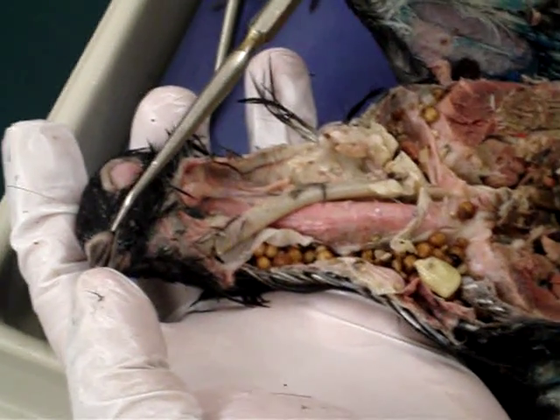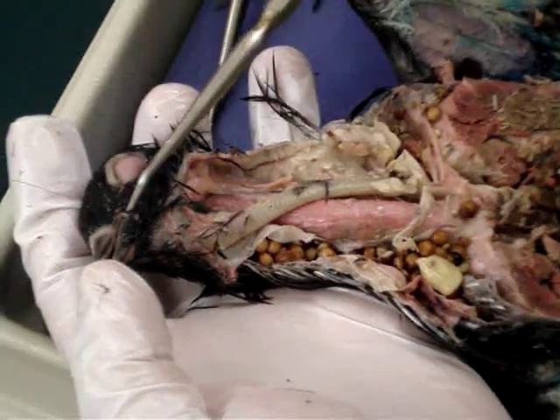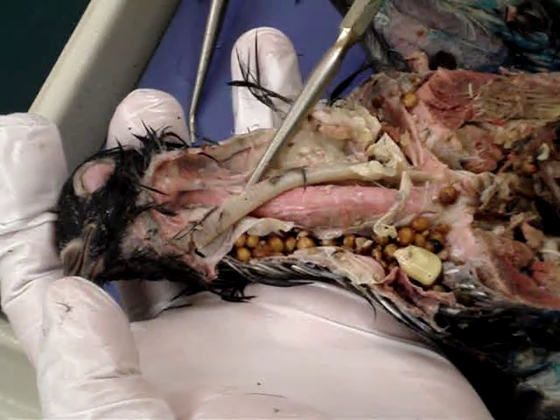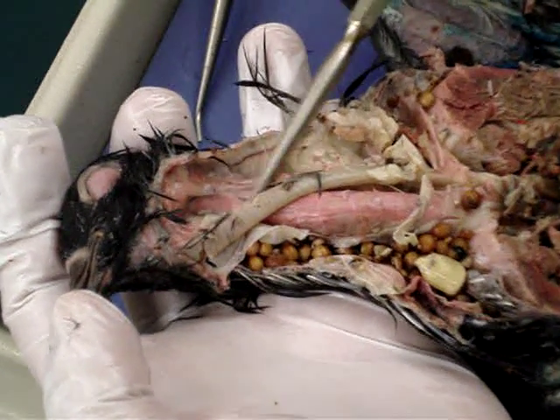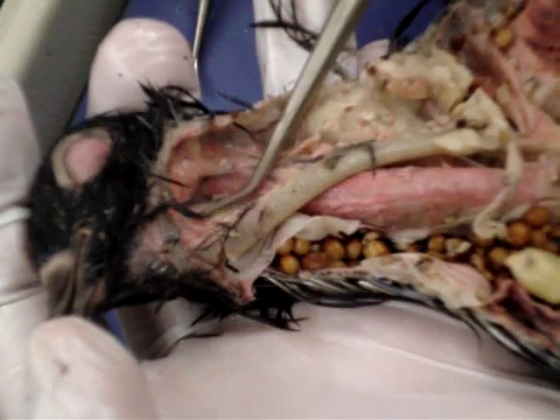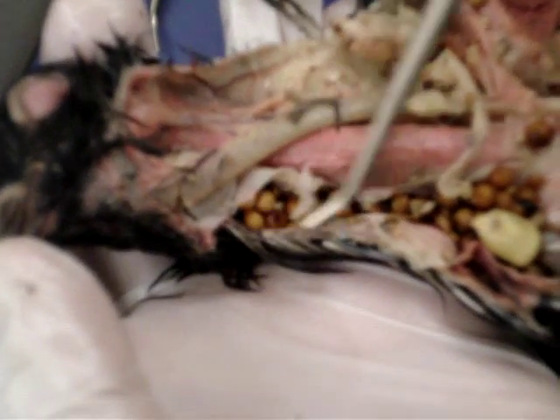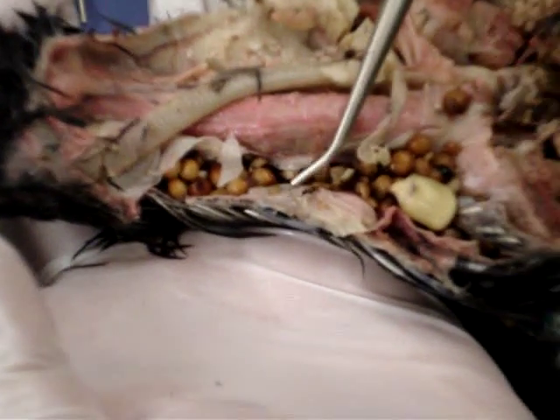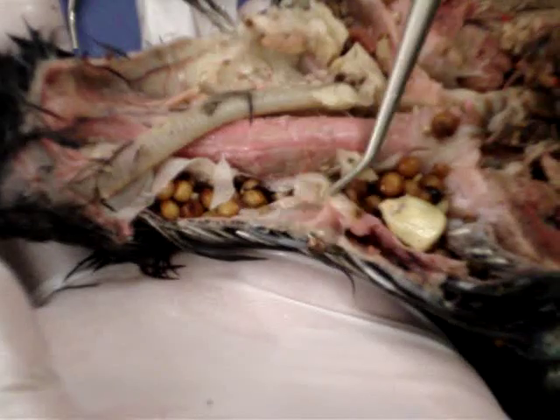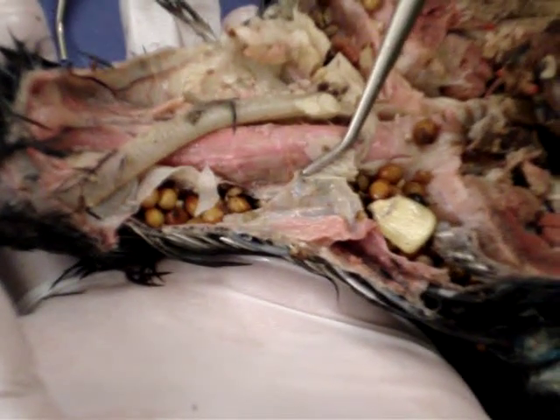Pigeon. The first item on the list is the esophagus. Since it follows the mouth, the esophagus is here — this section is the esophagus. Below it is the crop. This section here that has been opened up is the crop. Normally it should be covered up like so.